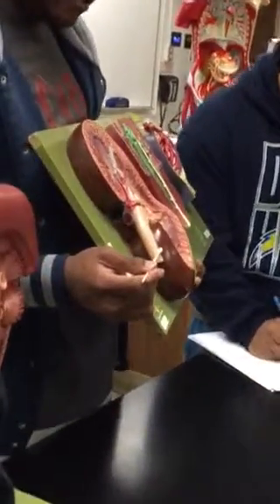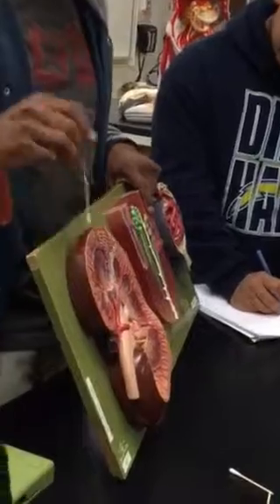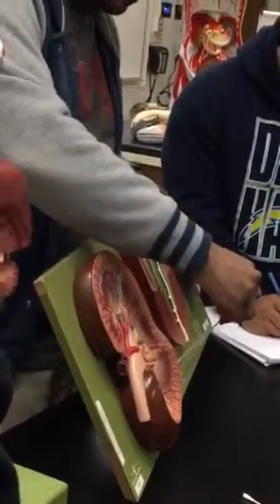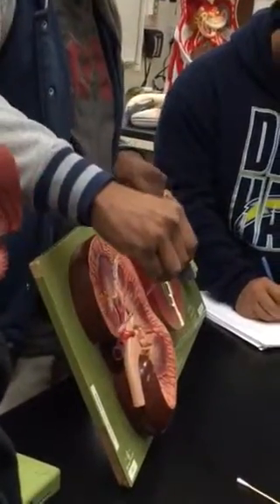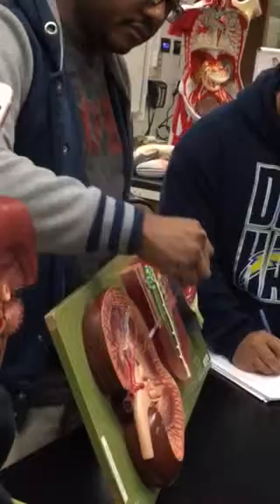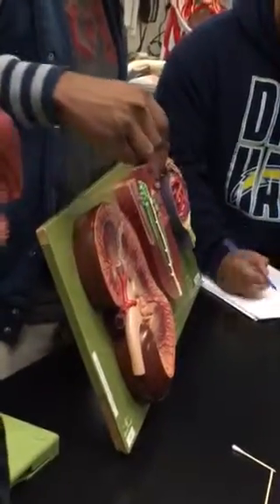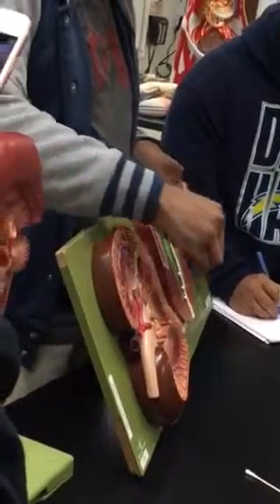Renal cortex. Okay. You've got to look in the kidney, and it's all the light color around it, close to the brown edge. So just all around here. This is the cortex. So it's the edge, like the cerebral cortex is the edge, right? This is the renal cortex.